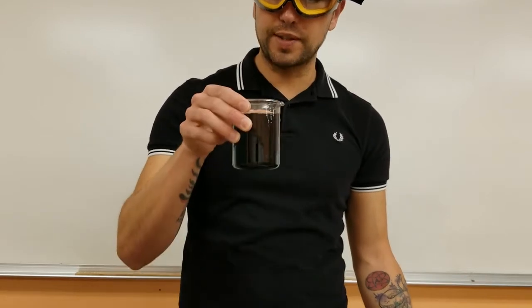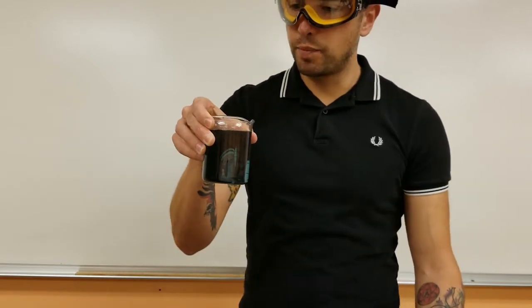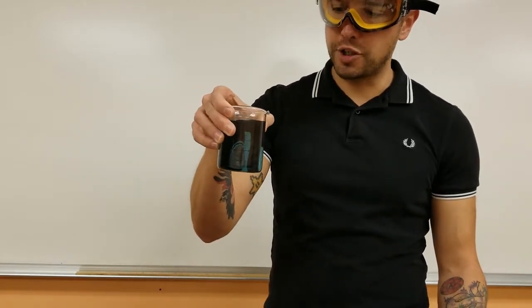So here this is just some tap water with some universal indicator. You can see it's pretty much neutral. The greenish color means it's neutral.